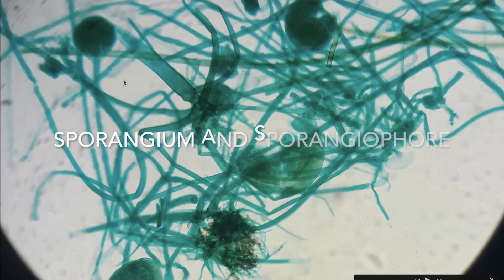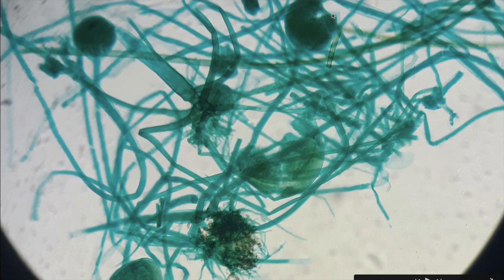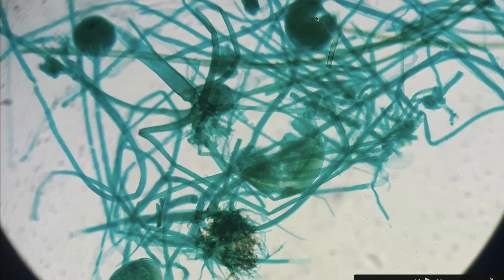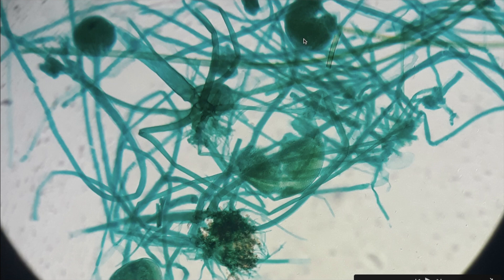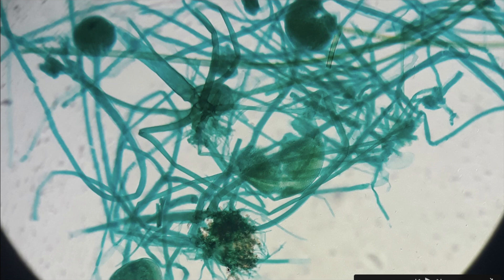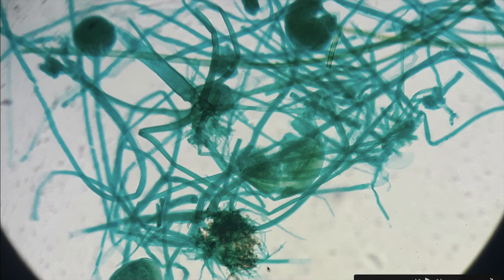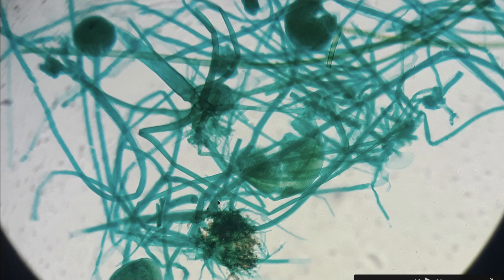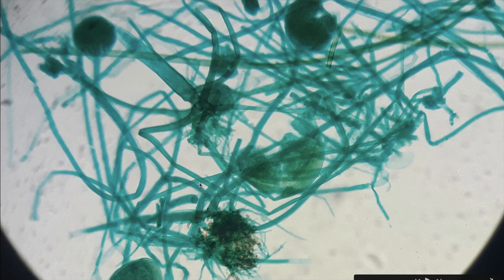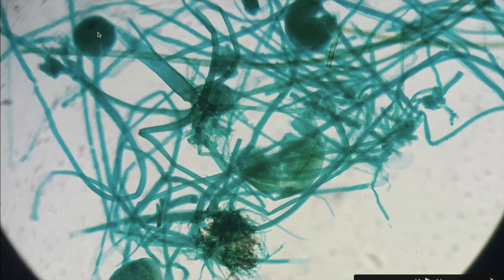Under the microscope we saw lots of sporangia. These are capsules in which spores are produced, and each one develops at the end of a reproductive hypha. Reproductive hyphae which bear one or more sporangia are called sporangiophores.